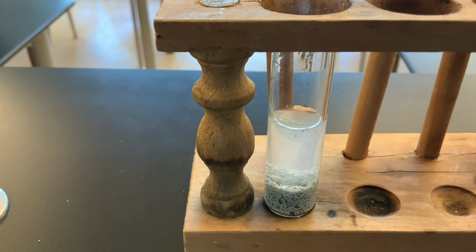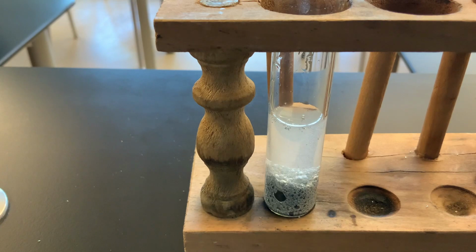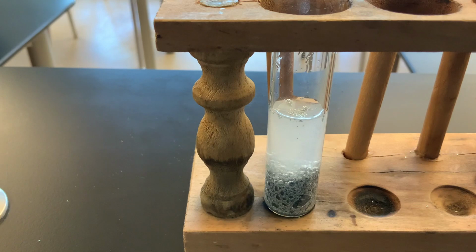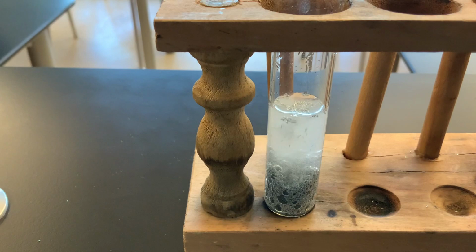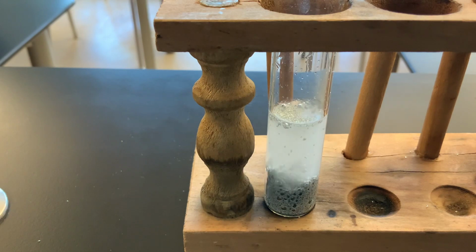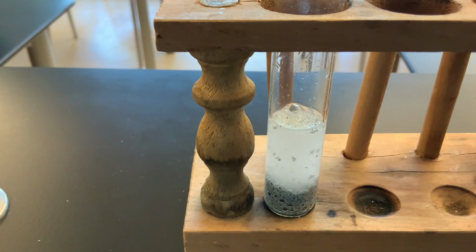So what I want you to do now is there will be a link that will follow this portion of the video, and I just want you to go to that link. It'll take you to a Google document, and I just want you to go ahead and write down some of the observations that you can make, okay? And then answer the other question that is on the Google Doc, so that we can try to figure out exactly what the products of this particular reaction are, which will allow us then to predict the ratio at which elements within one of the products combine.